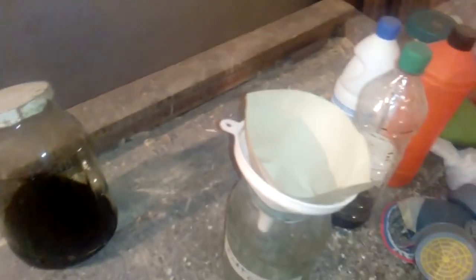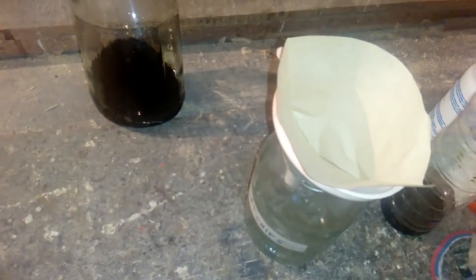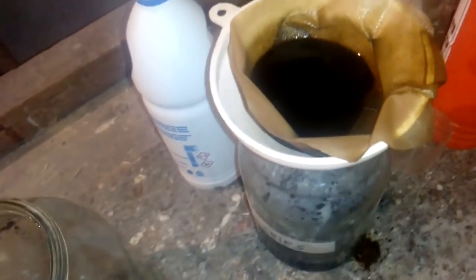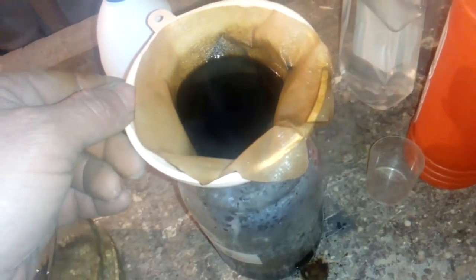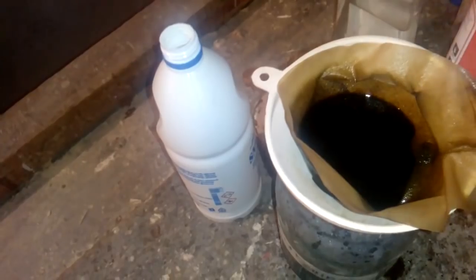Because I cannot take a shot with my phone at the same time when I'm filtering this. We are filtering the AP solution — we keep this solution for some other time to process, maybe. Hard to film. And we keep the filter — we take it with another filter. Now we are left with these. You see there's a lot of plastic there, but when you see — no iron or copper wire inside.